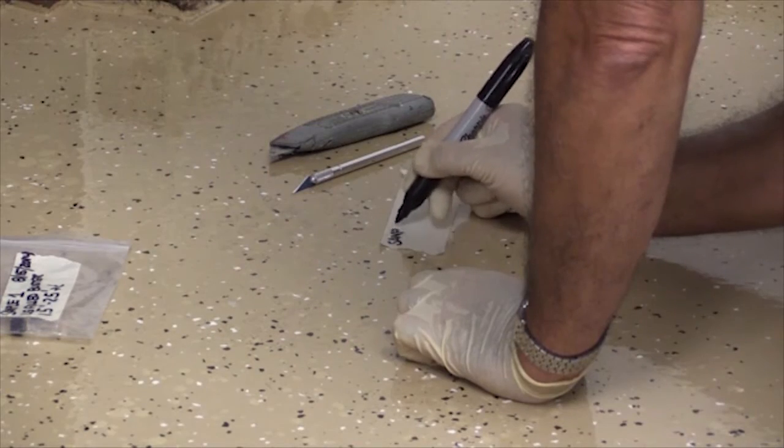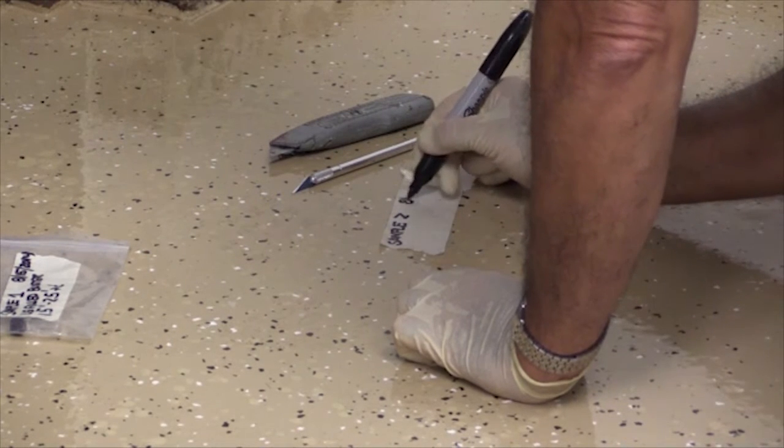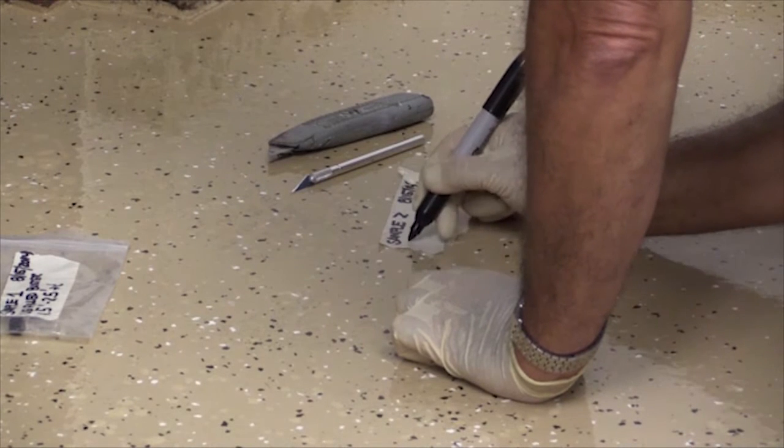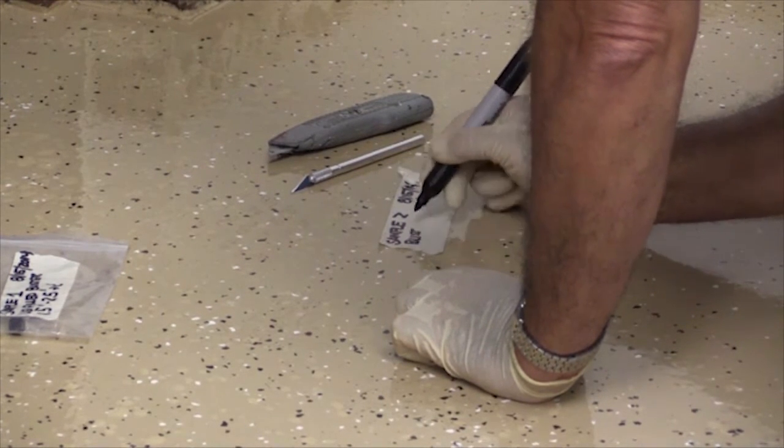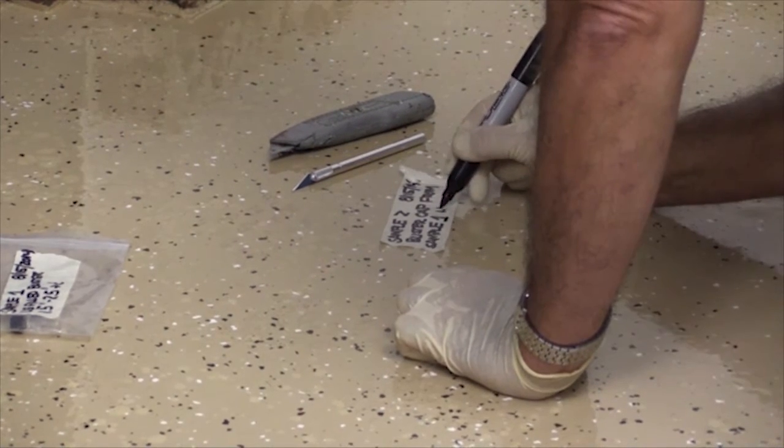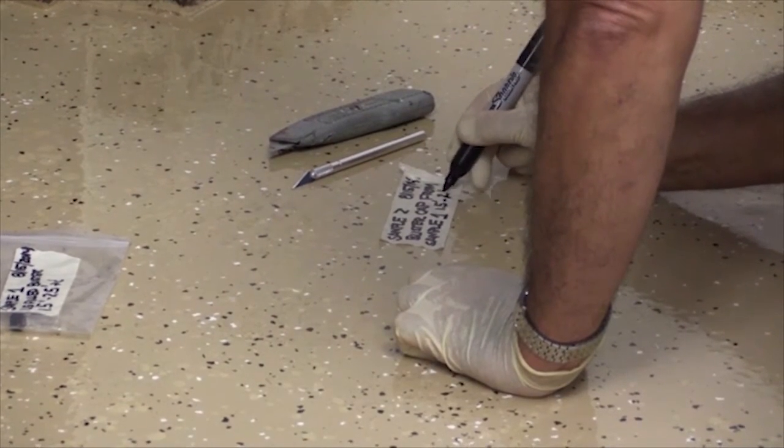It's sample two, today's date, and I'm going to label this a blister cap. It's about a foot and a half from the door and about two and a half feet from the corner.